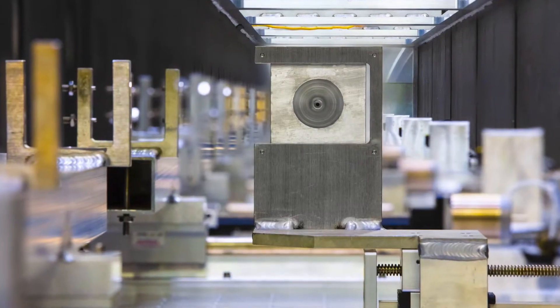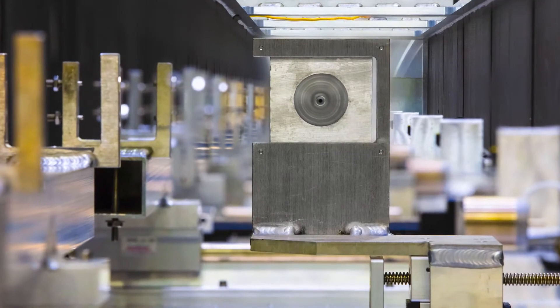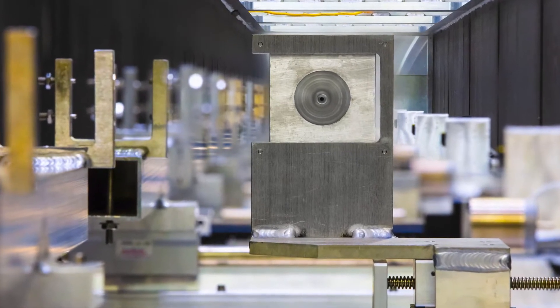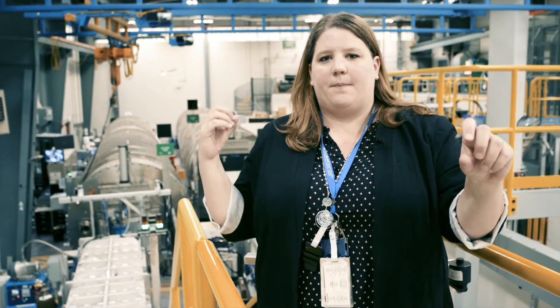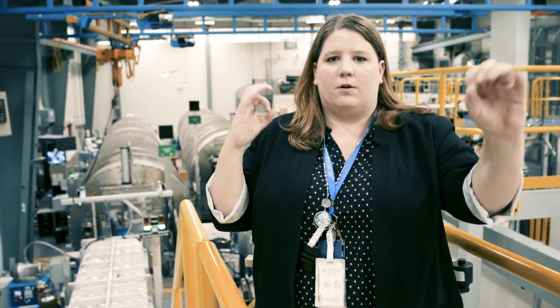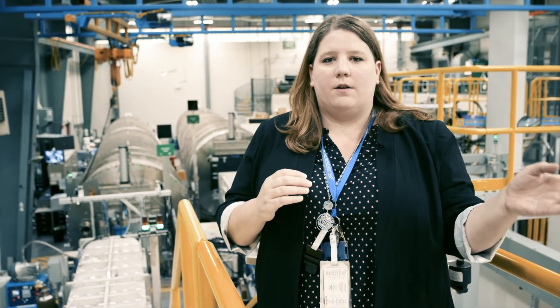This collimation section is a little bit different than the other ones you've seen around the facilities. It's more of a pinhole geometry, so we have a source aperture and a sample aperture. We can put guides in or out to help increase the flux on sample or increase the resolution of our instrument.